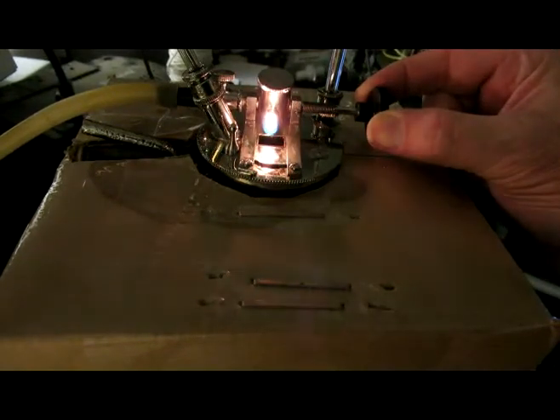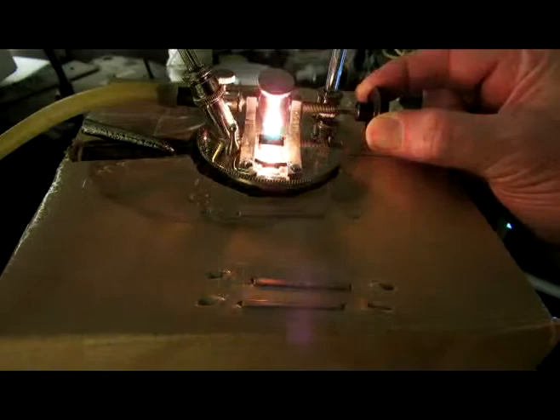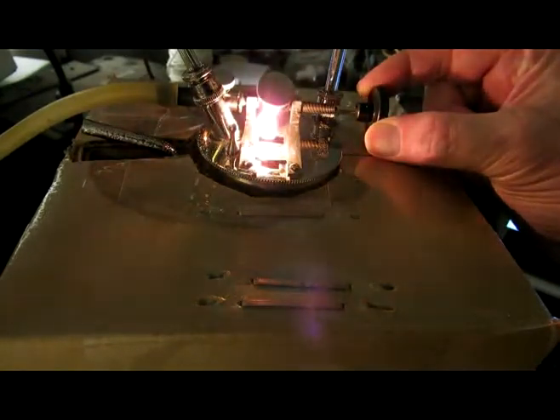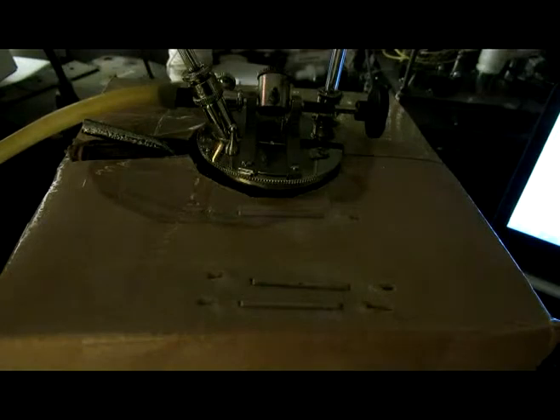You can see the green hue maybe from the burning of the n-Propyl bromide. You can see it just dancing now. I'm just holding it right there. But it's not flashing in the cup. There, it's just staying in there. Yeah, it stayed lit. If I do a regular flash point test, it goes out. Well, let's just look at the data on the computer real quick.